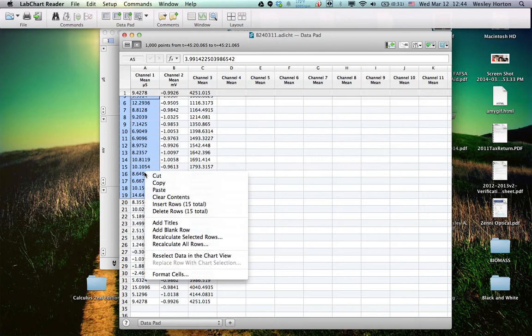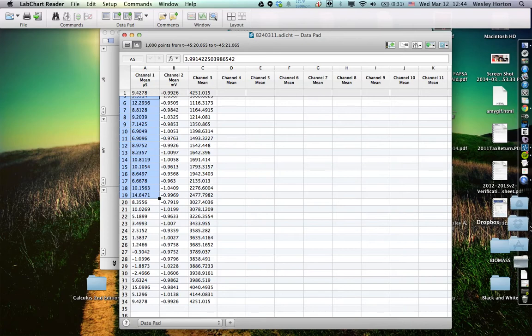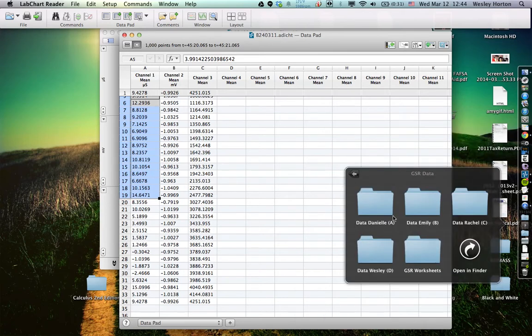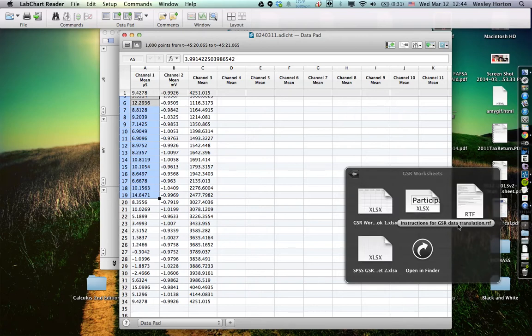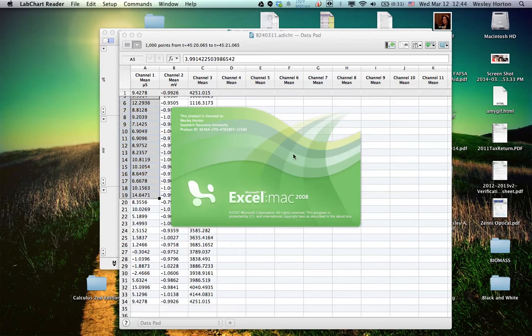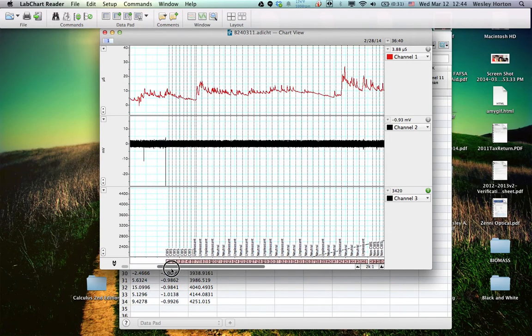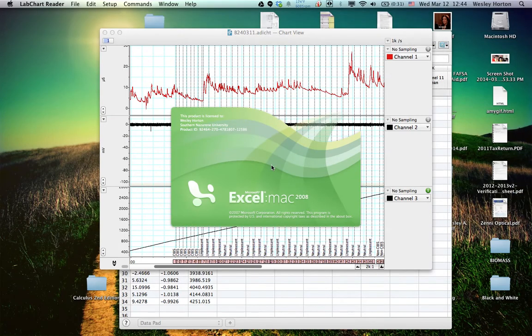All right, so we're gonna copy that. Now we're gonna pull up our first worksheet, which is GSR worksheet 1. Now remember, this is unpleasant, and based on this, the first 15 are sibs. So whenever our Excel file opens up, we'll be able to change it over.